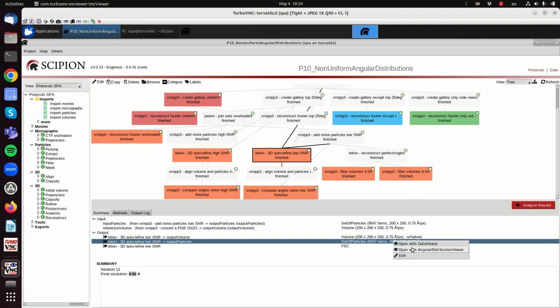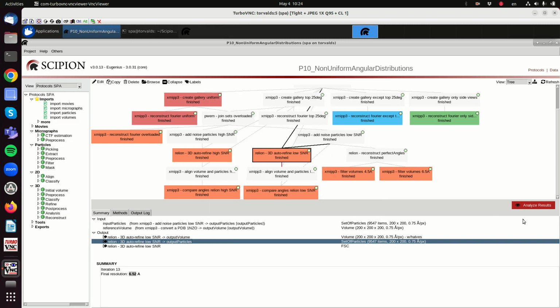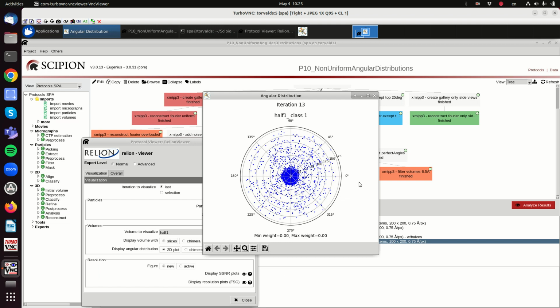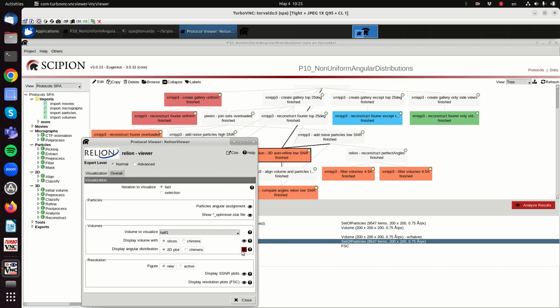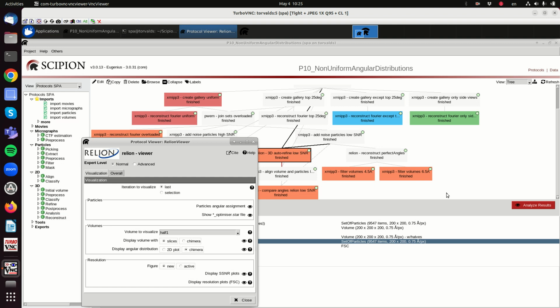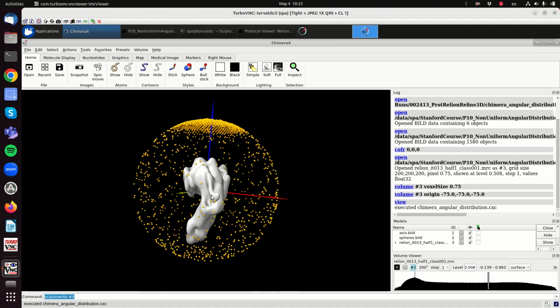In the angular distribution, this is not so easily seen because of the scale, but let's see if we can have a different representation of that. Yeah, this one here. So we have many more than we should, and there are some mistakes, especially here in the central area. This is this 3D view, where we have top views that are much more frequent than the rest.